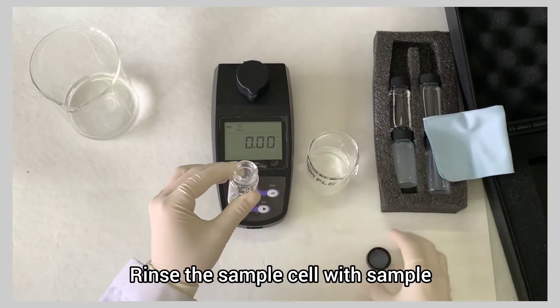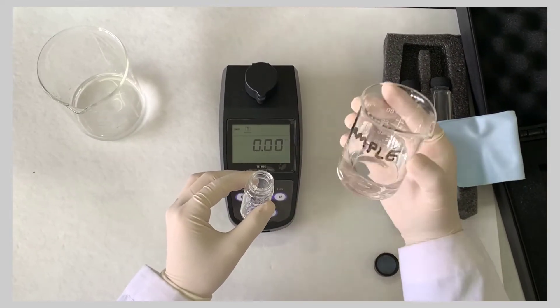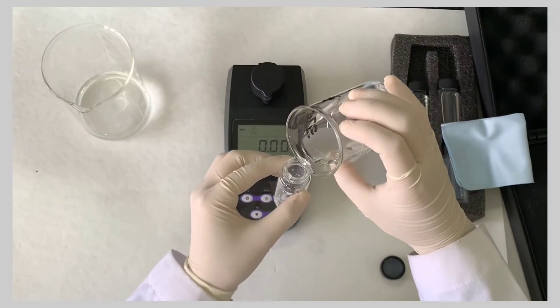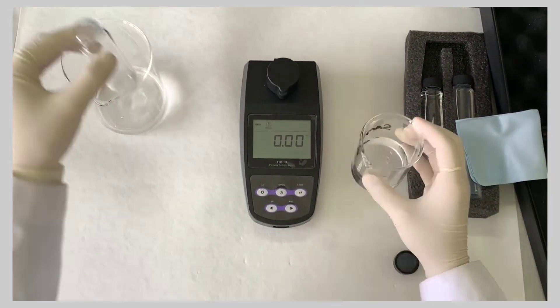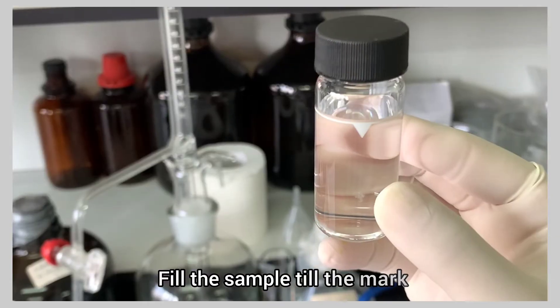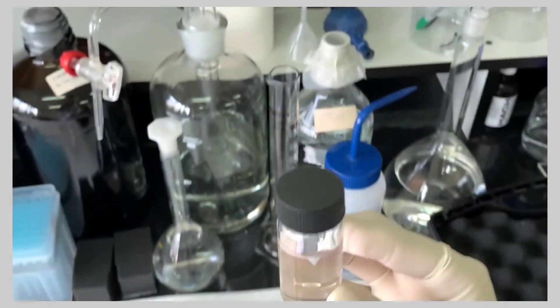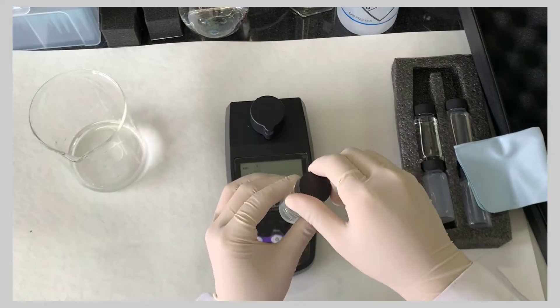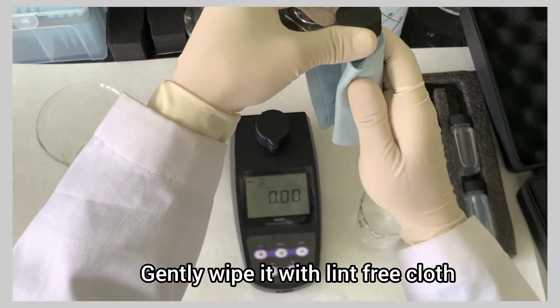Rinse the sample cell with sample. Fill the sample till the mark. Gently wipe it with lint-free cloth.